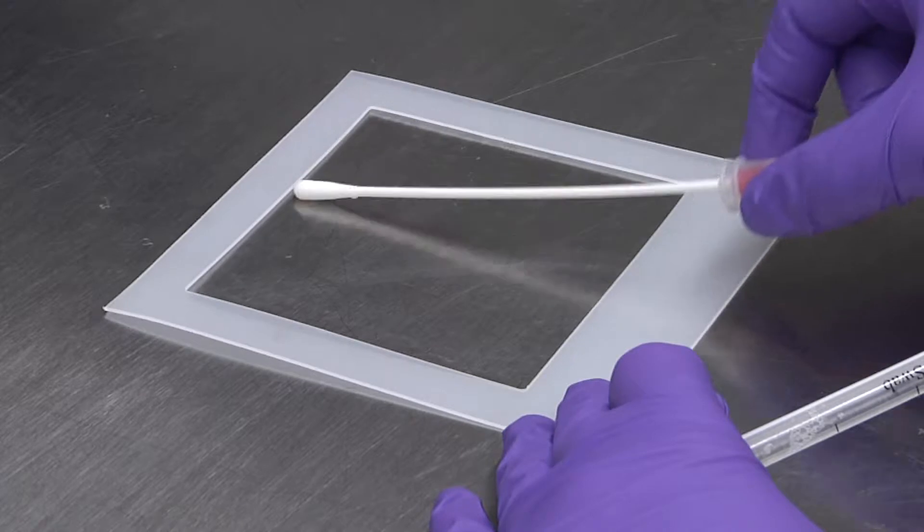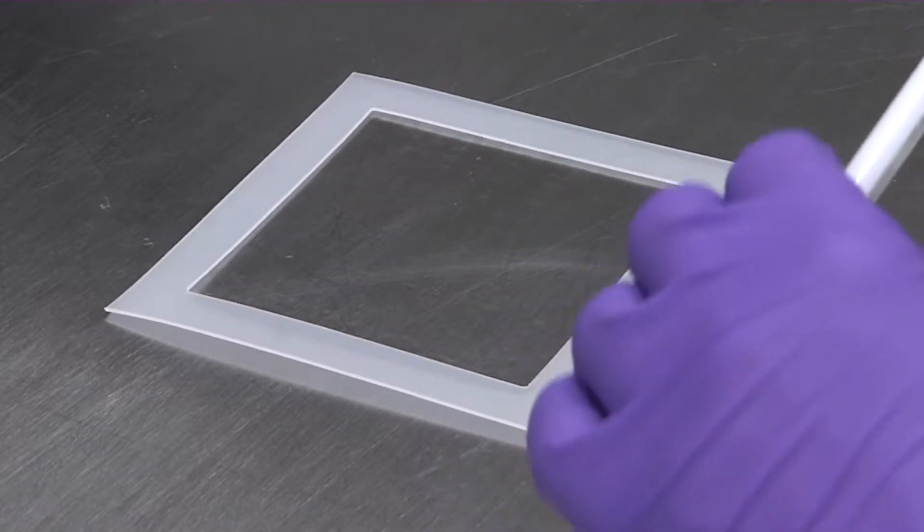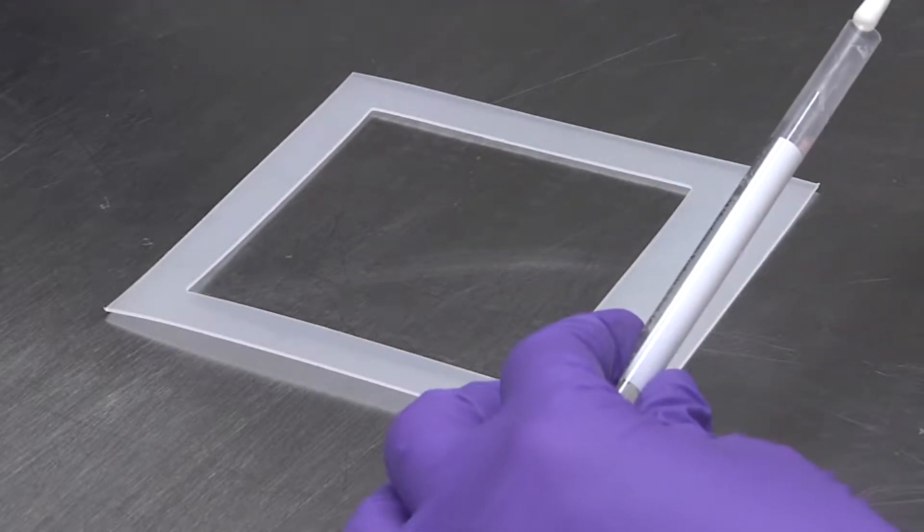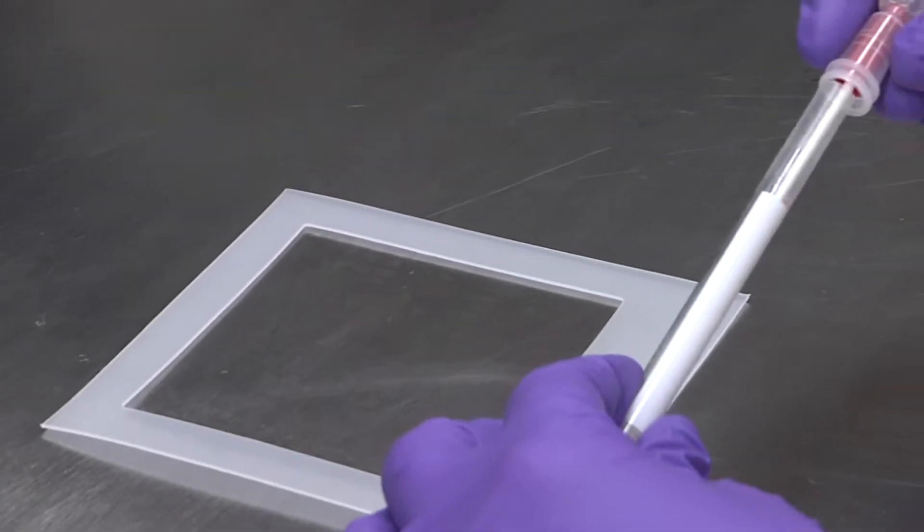Once complete, place the swab back into the sheath. Mark the test tube to designate the area where the swab was taken.